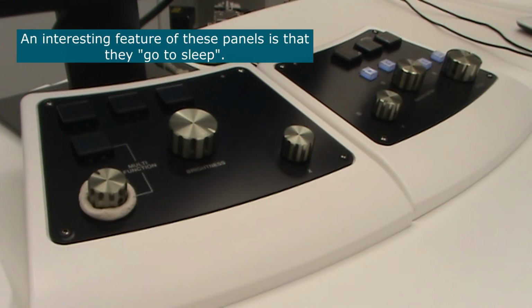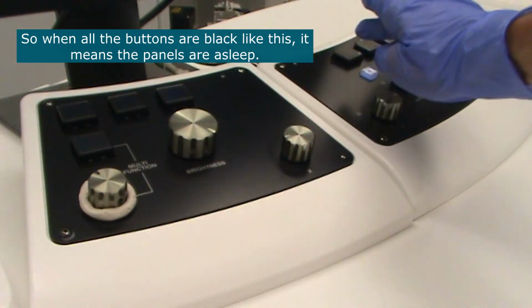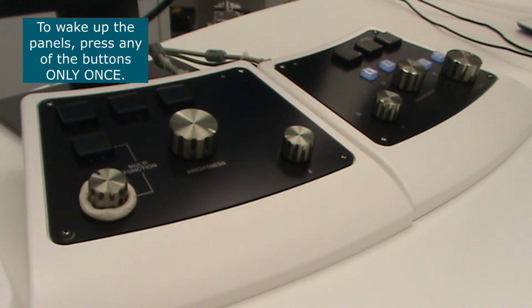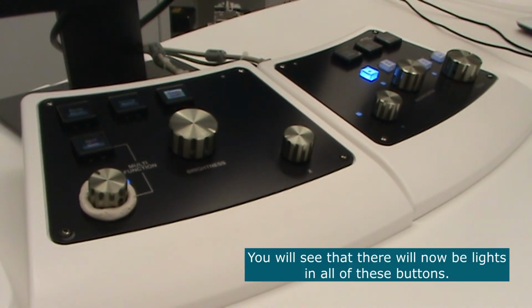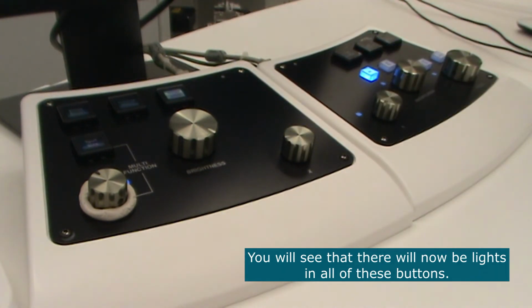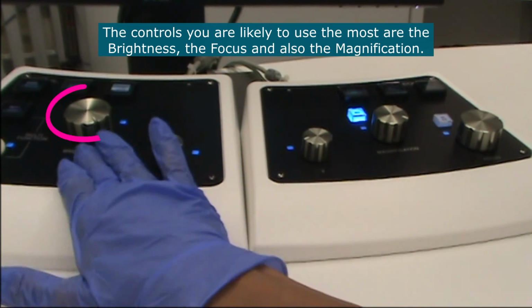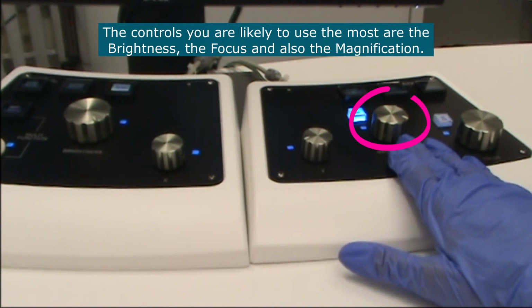An interesting feature of these panels is that they go to sleep. So when all the buttons are black, like this, it means the panels are asleep. To wake up the panels, all you need to do is press any of the buttons only once. You will see that there will now be lights in all of these buttons. The controls you're likely to use the most are the brightness, the focus, and the magnification.